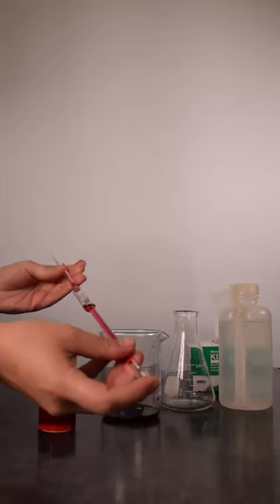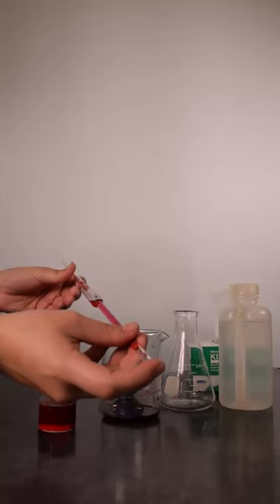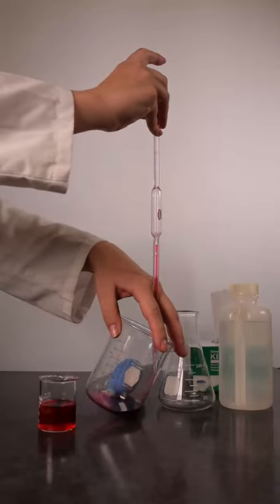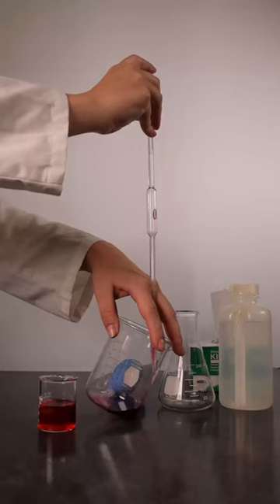Next, rotate the pipette to coat the inside of the bulge and carefully release your index finger to allow the solution to rinse the top portion of the pipette. Once the inside of the whole pipette has been coated in solution, drain into a waste beaker.